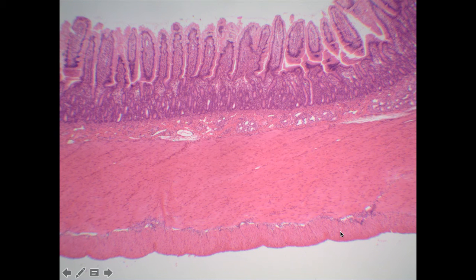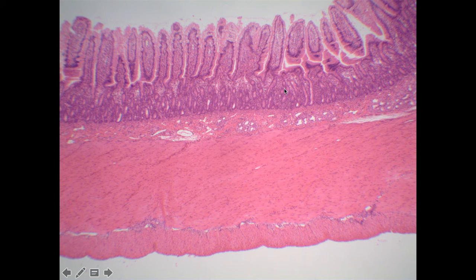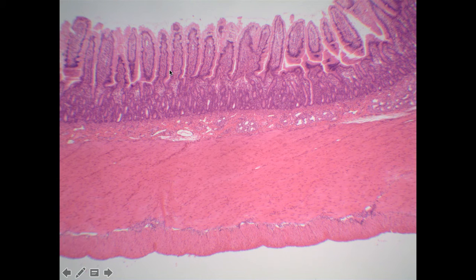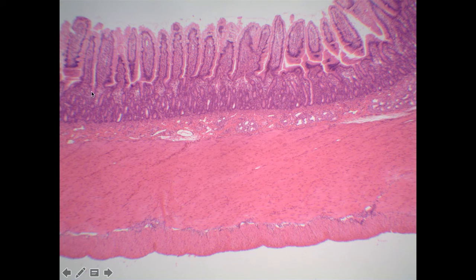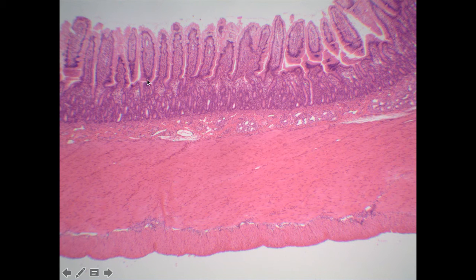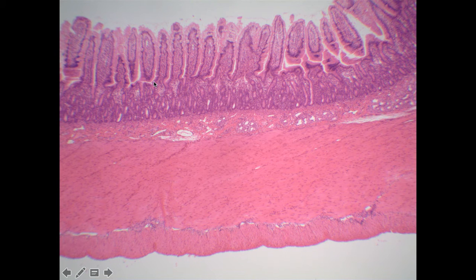The next region is going to be the small intestines. The thing to notice here are these finger-like projections, or villi. The small intestine is the only region that can have these villi. These are small finger-like projections, and they still have these little pits — these little crypts as the epithelial layer extends down. In addition to that, they have these finger-like extensions, the villi, that extend up into the lumen of the small intestine.